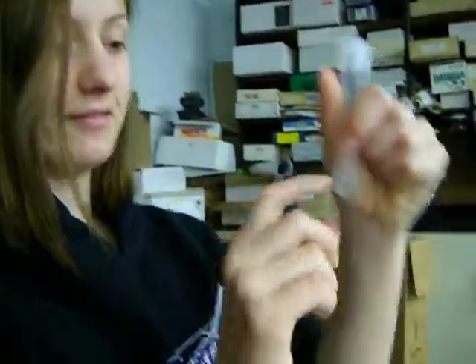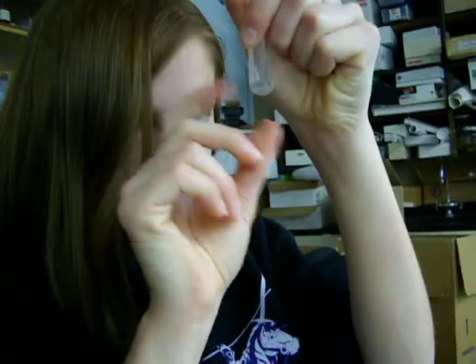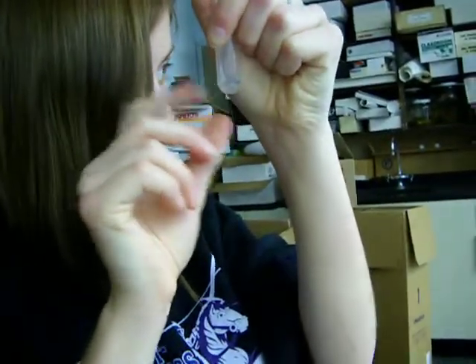You know what, I'm actually gonna add a little bit more to the other one.